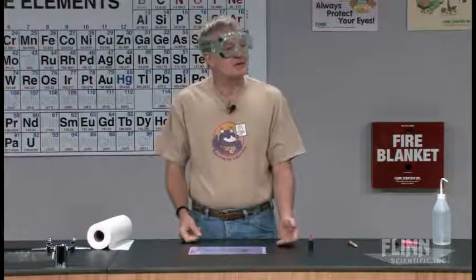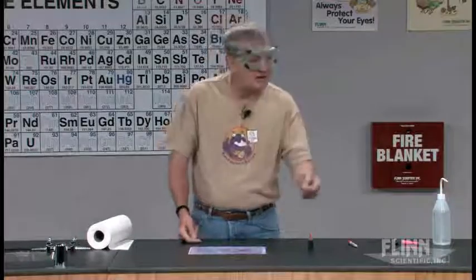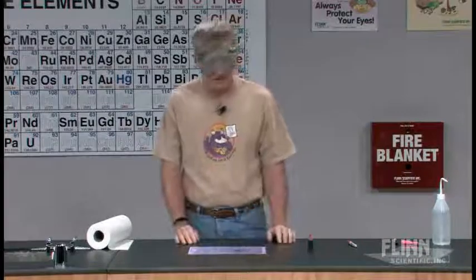If your eyes start to itch, they start to bother you a little bit, and you've got contact lenses, I need to know about that. We're going to get you out of the classroom, take you down to the nurse, get that eye washed out quickly. If it's an itching situation. Of course, if you splash something, that's an entirely different set of circumstances. We're going immediately to our eye wash station in the classroom.